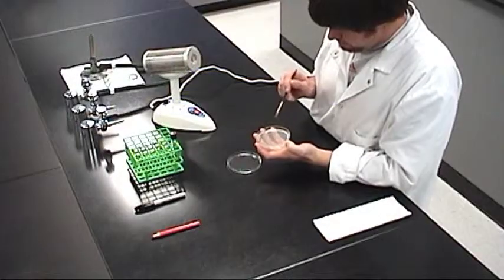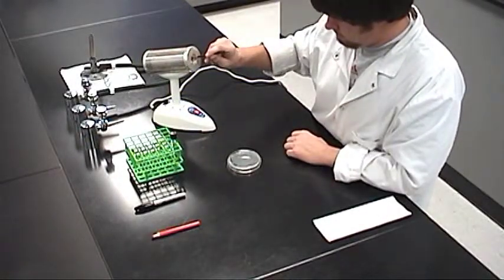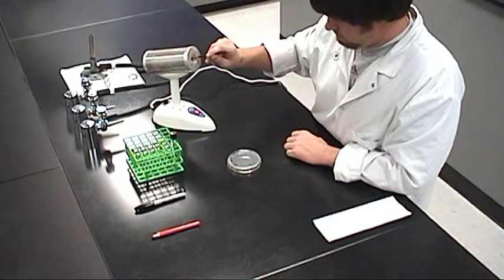When you finish the quadrant, lower the plate onto its lid to prevent contamination. Then flame the loop for at least 5 seconds to sterilize it.